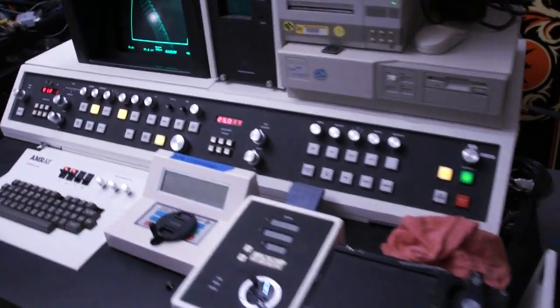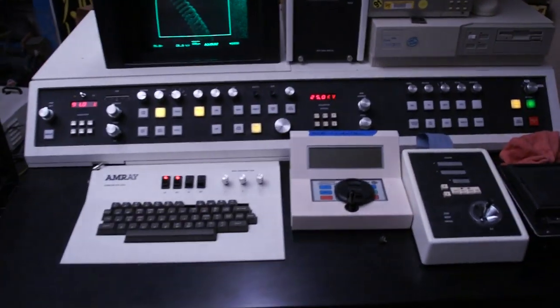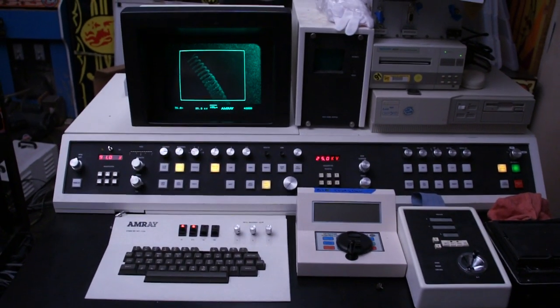Hi guys, I thought I would show you my electron microscope before I button it up and put it back together. I've been refurbishing it the last couple months.